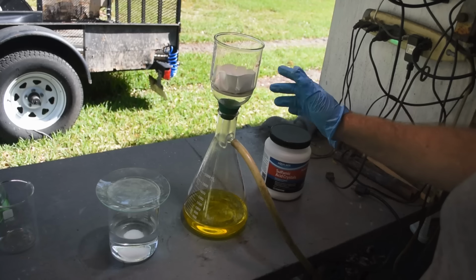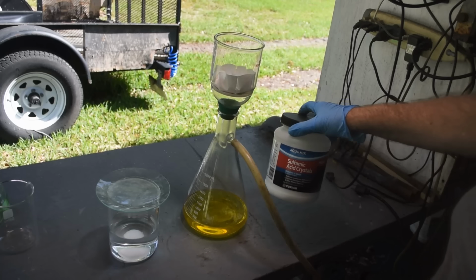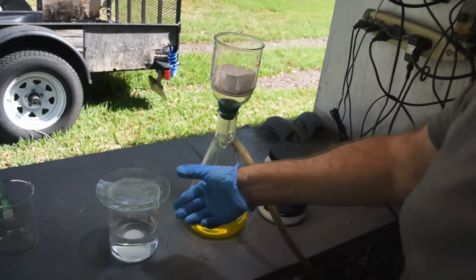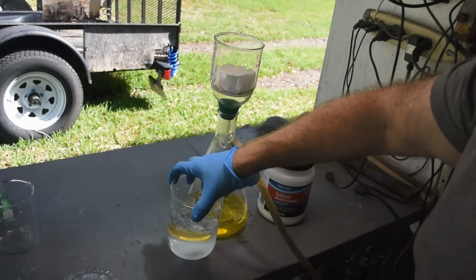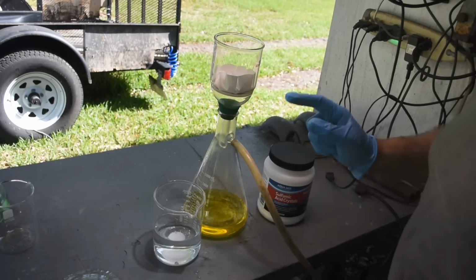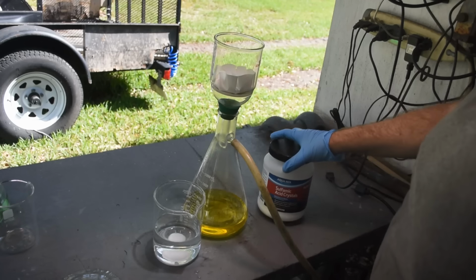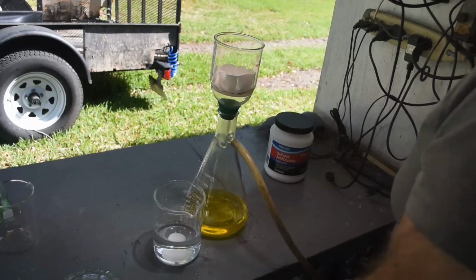I'm going to run a saturated solution of sulfamic acid here right through the same filter that I've been using all along, just to make sure that there is no debris going into the gold, because the sulfamic acid is industrial grade. It's basically used for cleaning tile grout, okay? Works great for this application though. I mixed up a lot of it because there's a lot of nitric acid in this stuff. I used a really strong aqua regia.